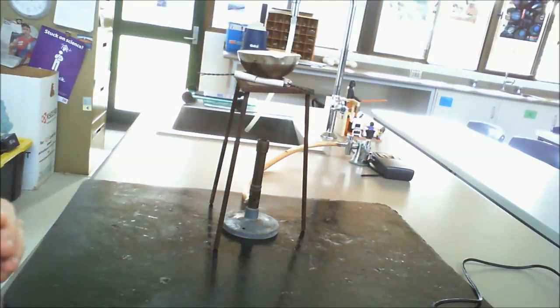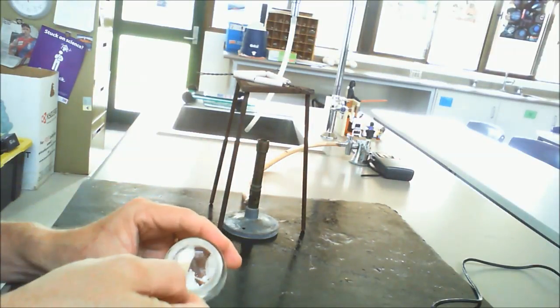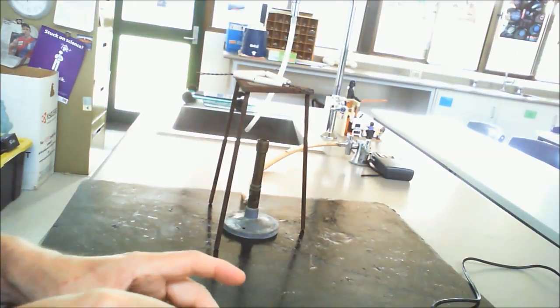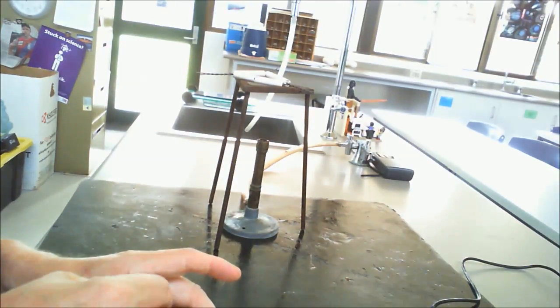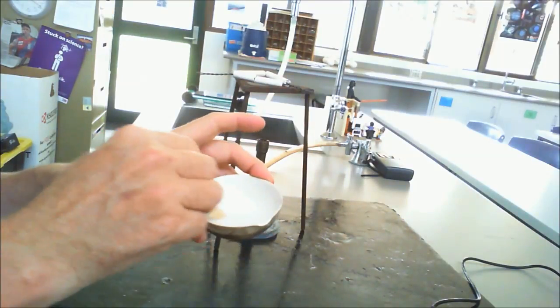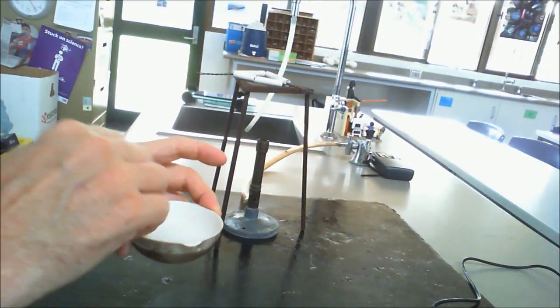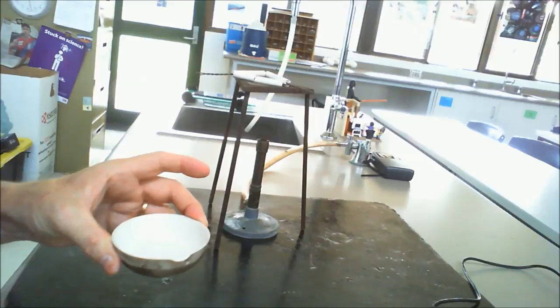Okay, so what I want to do, just to make sure that I've got everything reacted there, is I'm just going to put a little bit more in, just to ensure that I have no acid left. Just stir it around a bit, because I would rather have calcium carbonate left over, because that calcium carbonate tells me that if it is left over, we've used up all of the acid, and for this particular experiment it is the acid that's going to be the problem. So I've stirred all that in. Okay, better to be safe than sorry.